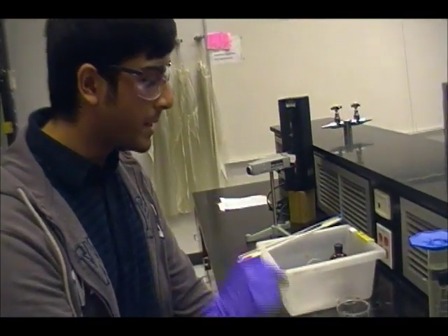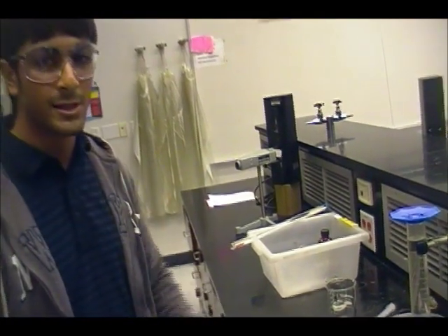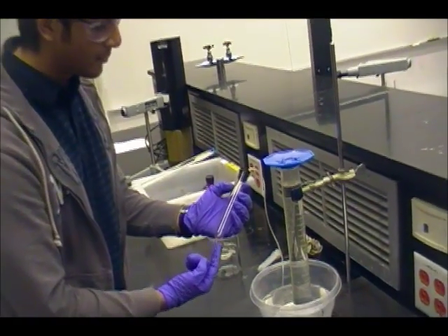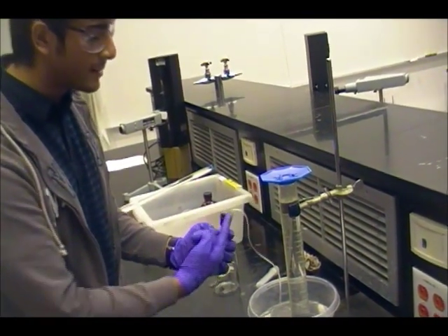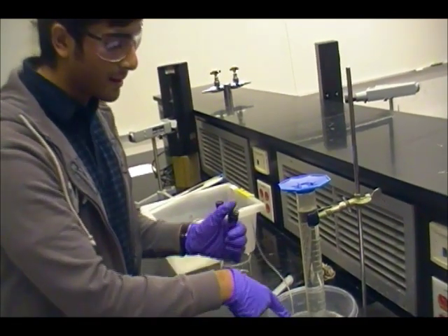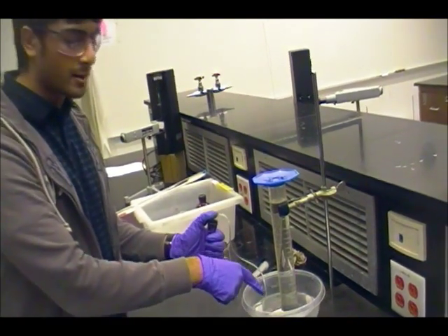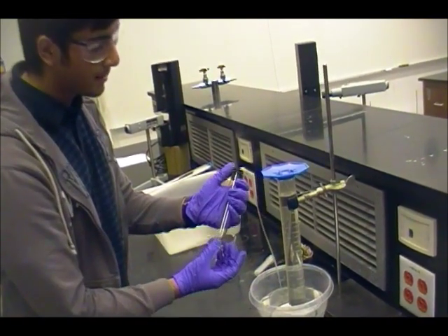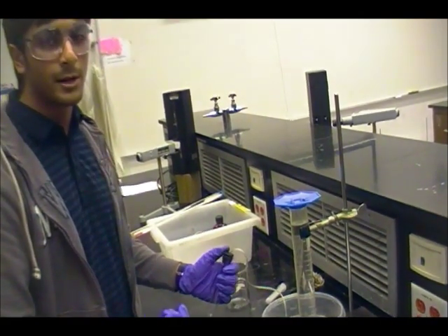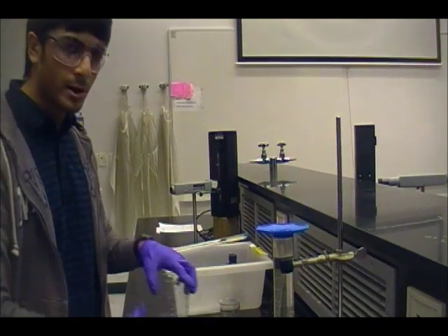Now, we want to pin the hose down at the bottom of the container, but we don't want to squish the hose, because if you squish the hose, that could impede the gas flow from the reaction with magnesium and hydrochloric acid all the way down to the graduated cylinder. And if it can't get past the point where the graduated cylinder is pinned to the hose, then pressure can build up in this test tube and pop the stopper off, which would make you have to repeat the trial all over again.